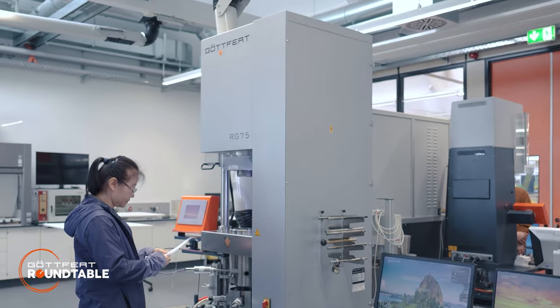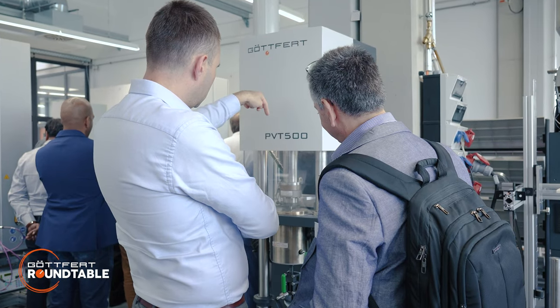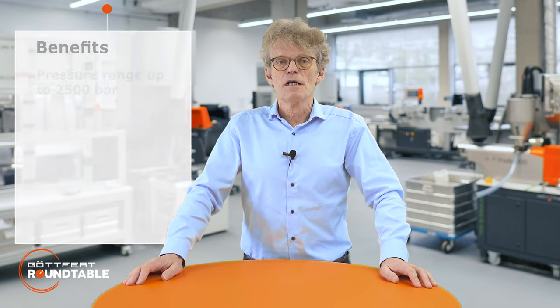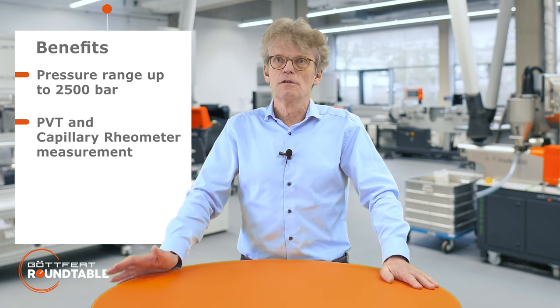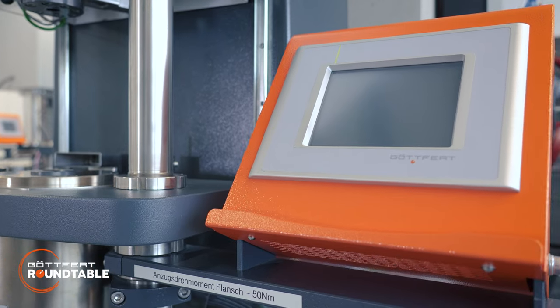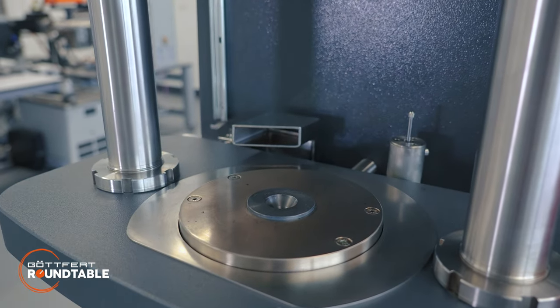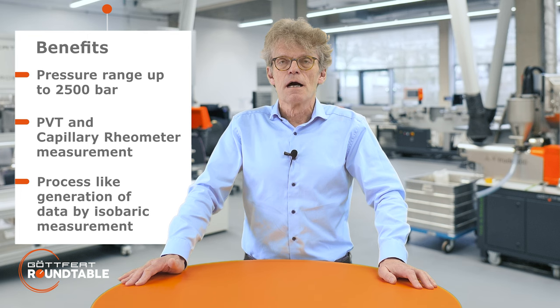For PVT testing, we have two different devices. On the one side, we have the option for PVT testing in a capillary rheometer, which allows either rheological measurement and also PVT testing, or just a single PVT testing device — the PVT 500. The benefit is the pressure range up to 2500 bar in both devices, with the full functionality of a PVT dilatometer. Especially the isobaric measurement allows to generate process-like data.